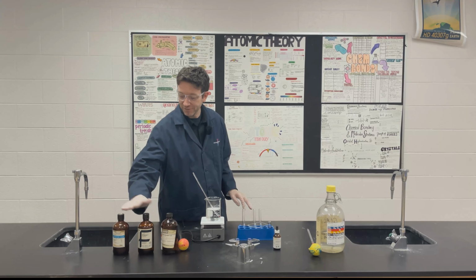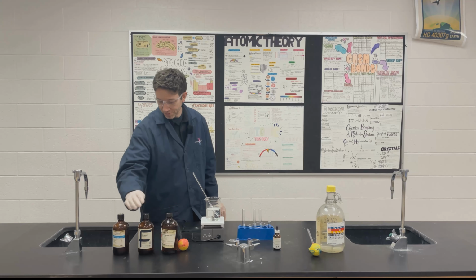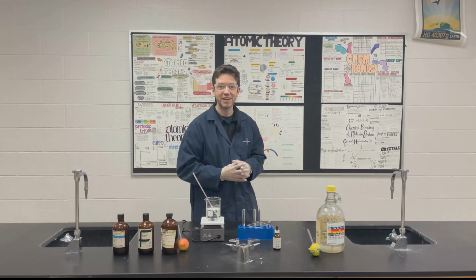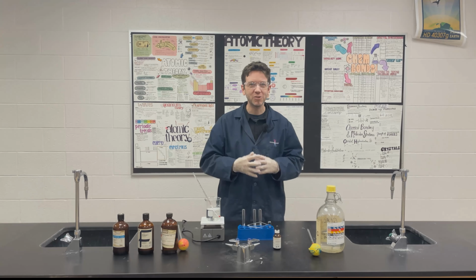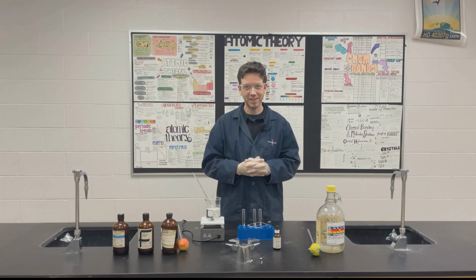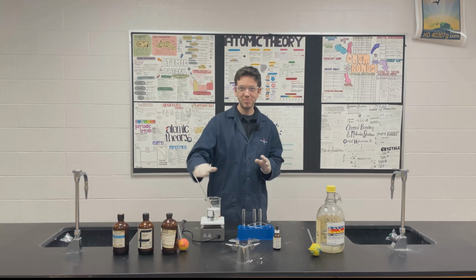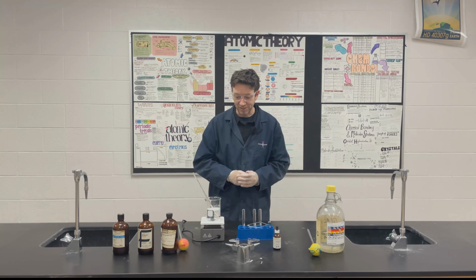And then we have different alcohols we are going to test. So we have one propanol, one octanol, one butanol. But you can test lots of different alcohols. The one I did on the board earlier is supposed to give you a sort of minty smell. I don't always have the best of luck with that one, so I don't use that one in the class. I use these three because they're very reliable for me, or I've found them to be very reliable.